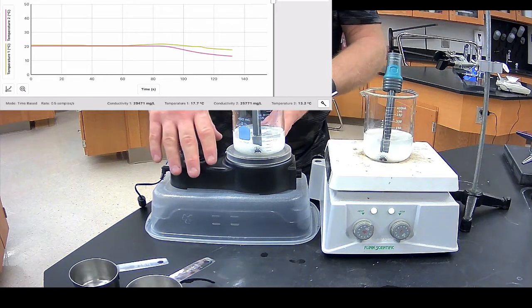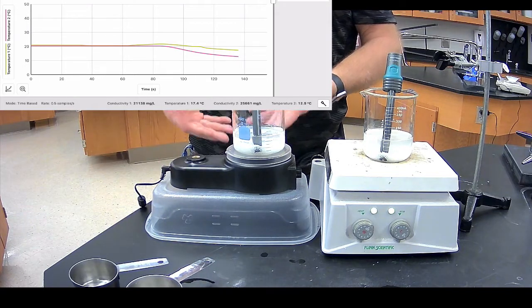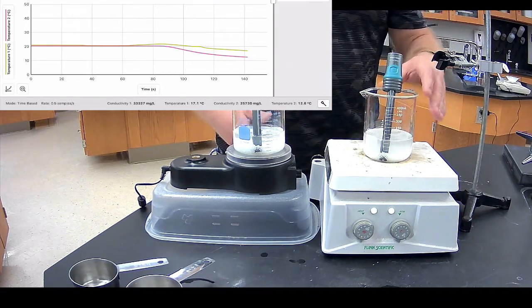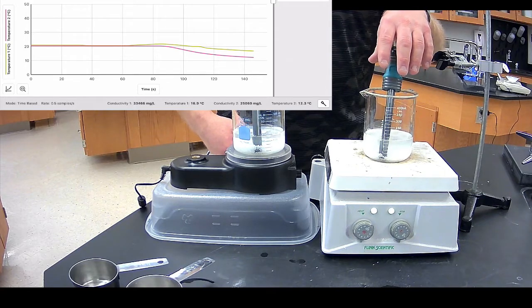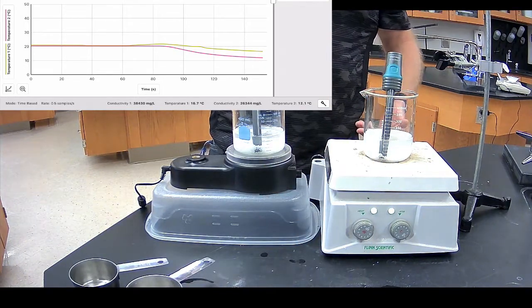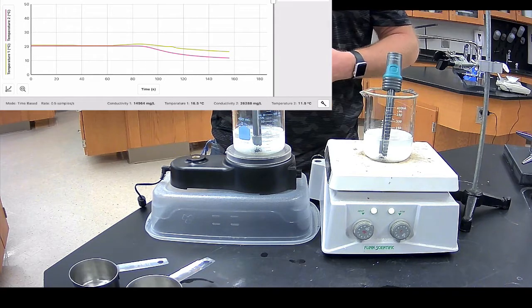Now, for the one that's not being warmed up, that should eventually level off for us or maybe continue to drop. The one that we are going to artificially warm up over here, eventually the heater is going to take over and it will actually warm it up more than it is cooling down. Okay, so we'll let these things run and we'll check back here in a minute.